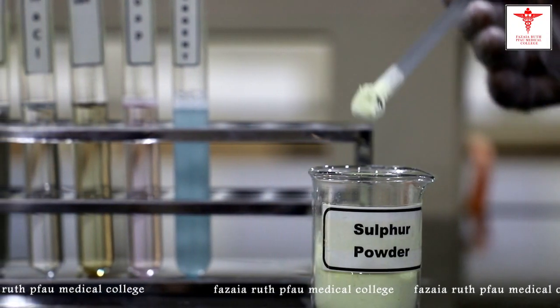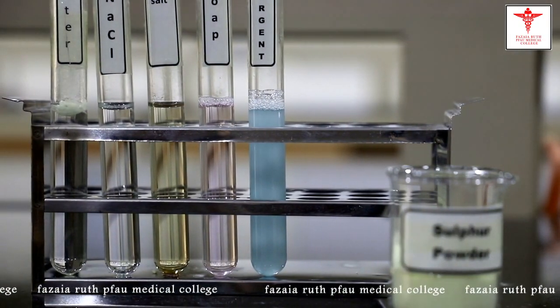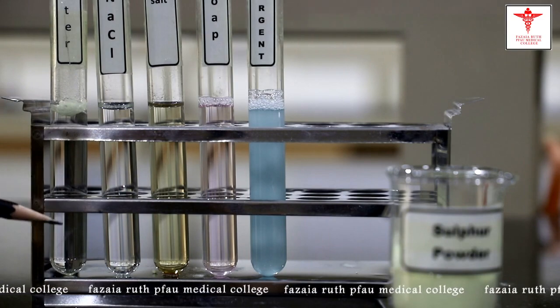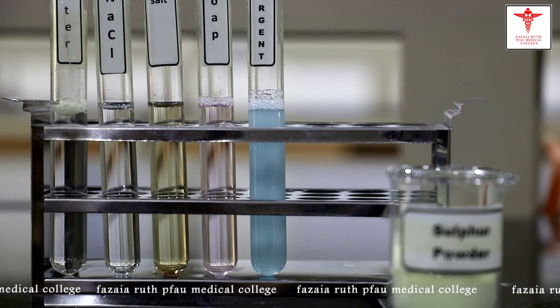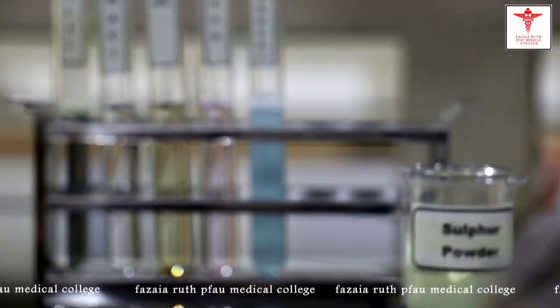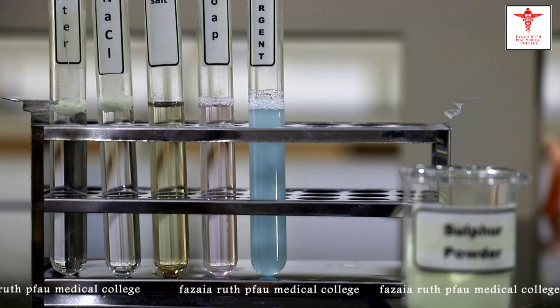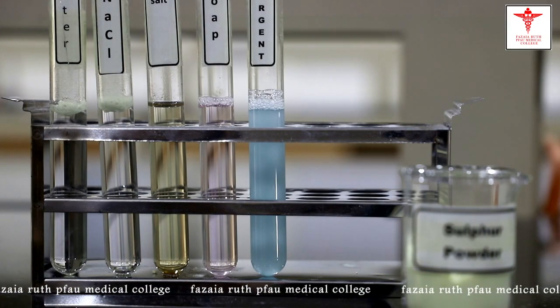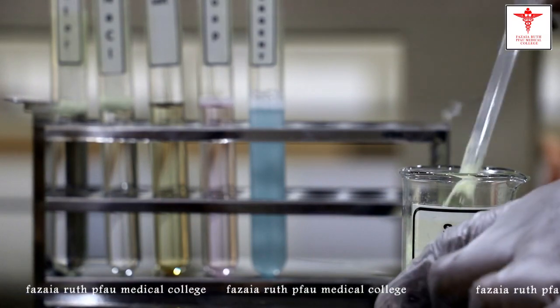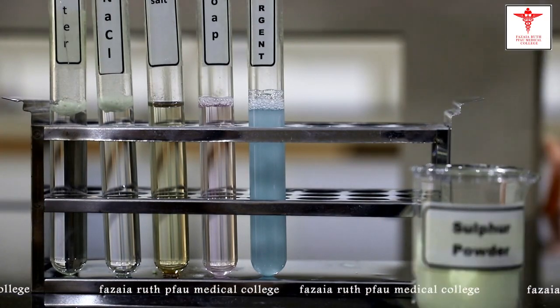Okay, students, we will now add sulfur powder to these test tubes one by one. First, in the distilled water, you can see the sulfur powder is still afloat and has not settled down to the bottom because of the surface tension. Now I'll add the powder to the second test tube, which contains 10% sodium chloride solution, and the powder is still afloat. Now we'll add the powder to the third test tube, containing bile salt solution.